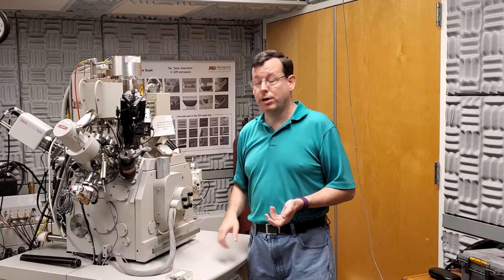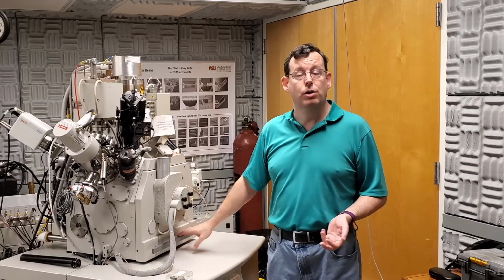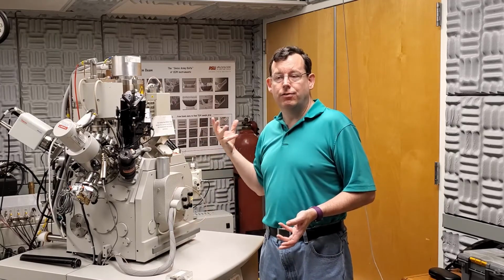To know when you're actually at room pressure, you're either A, going to have to tug on the door, or B, you can actually listen for the gas escaping from the chamber from the nitrogen cylinder.